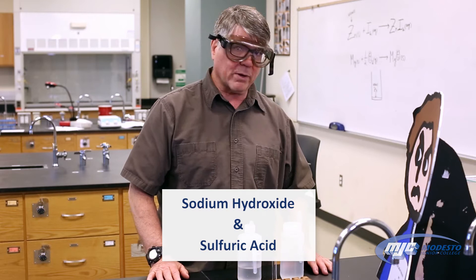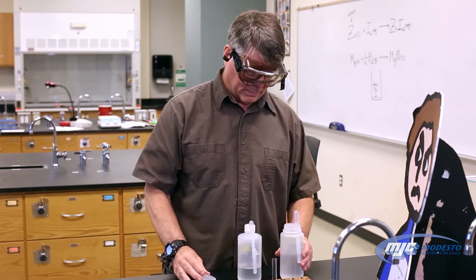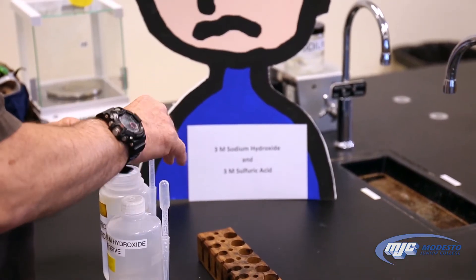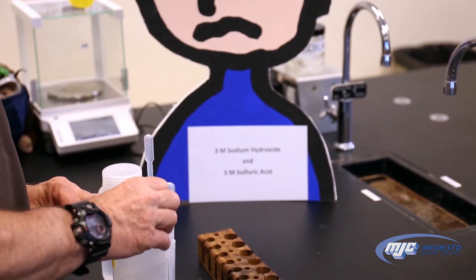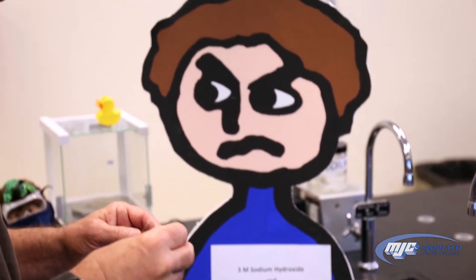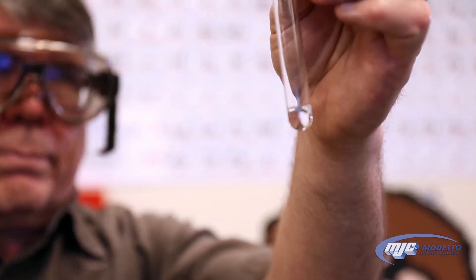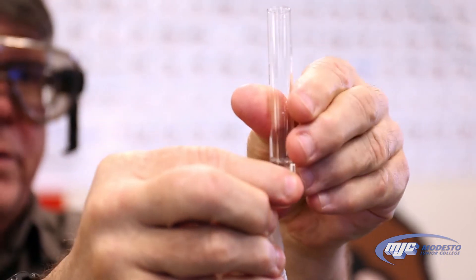This is the reaction, if any, between sodium hydroxide and sulfuric acid. Put the lids back on the containers. Wow, that's getting hot.